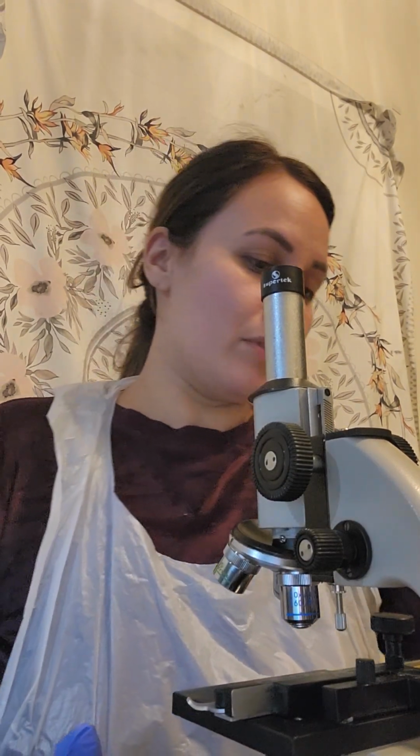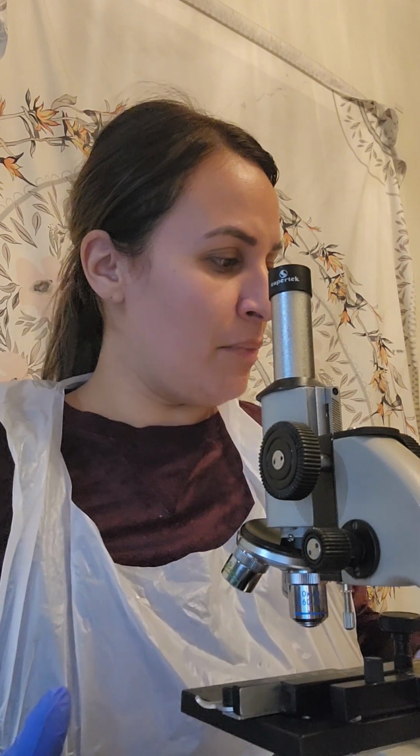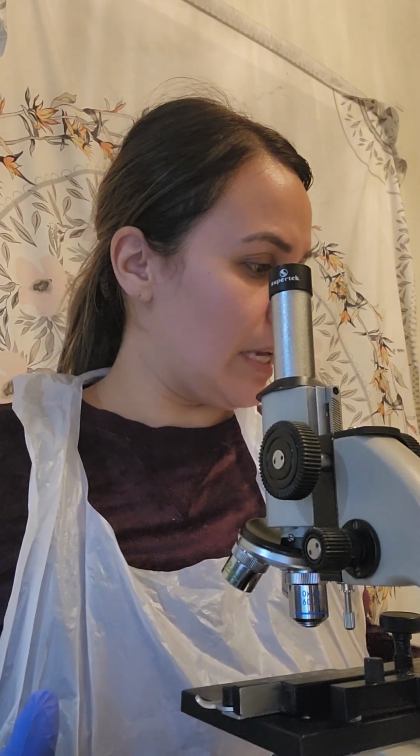Lab 4, microscopy for microbiology. This is exercise 2, where I'm going to be observing microbes and gaining proficiency in observing microbes. So I have all my slides here laid out.